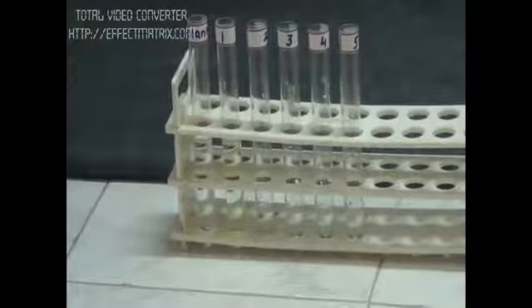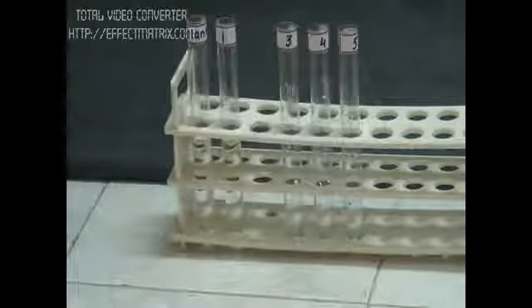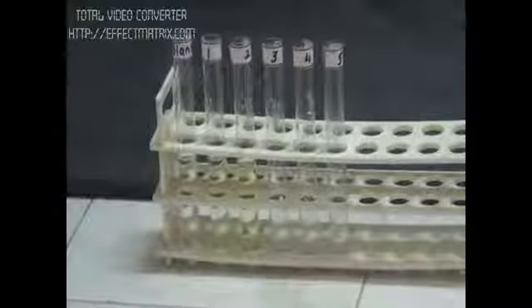As I am adding the NaOH, the color formation is taking place gradually. The color intensity in each tube will differ according to our aliquot. That color we are going to study; the intensity will give us the concentration. We are going to calculate the optical density of each. So when we get into the enzyme-substrate reaction, we can refer to this graph.